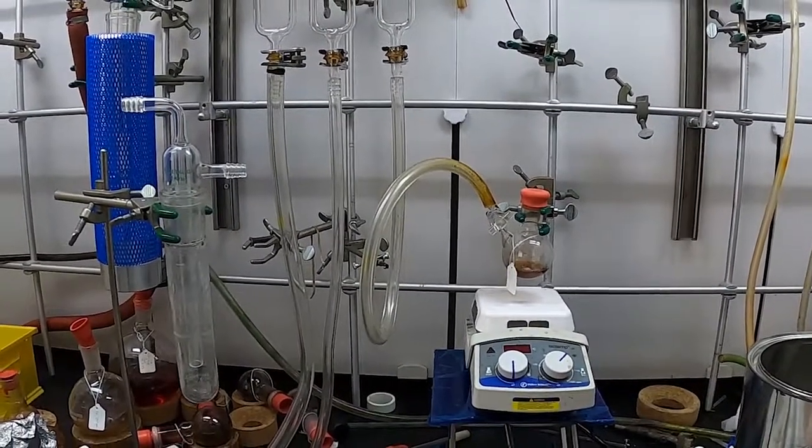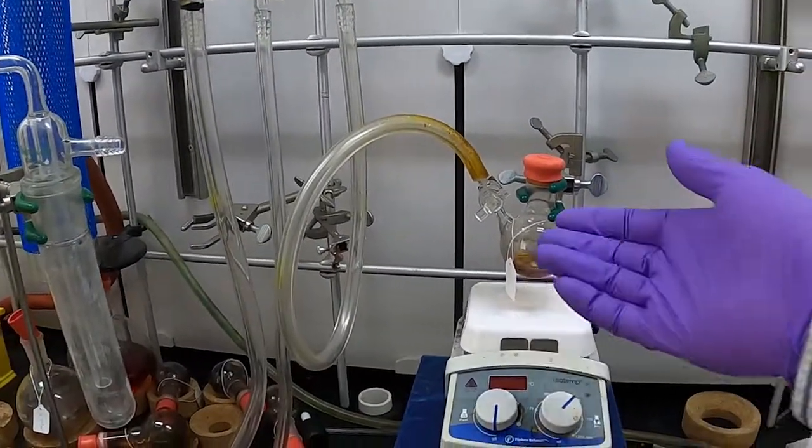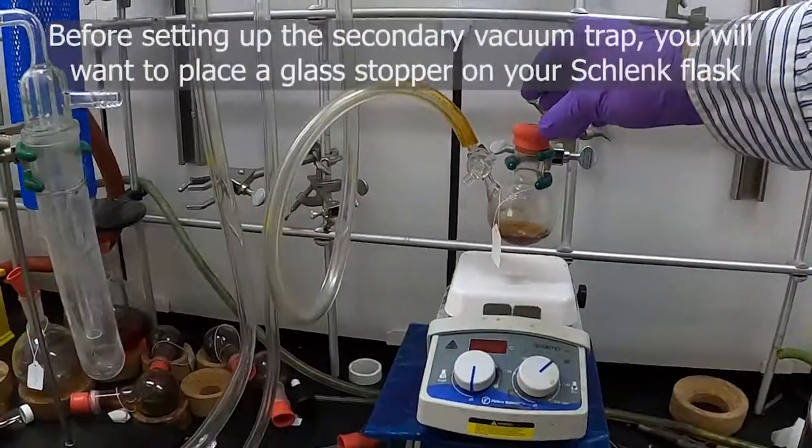All right, welcome. This video is going to show how to remove the solvent out of this flask on a Schlenk line for an air-sensitive compound.